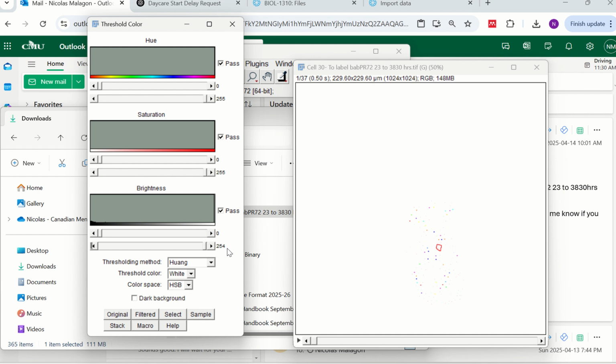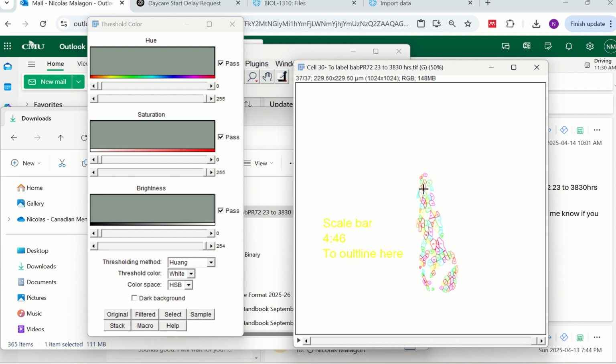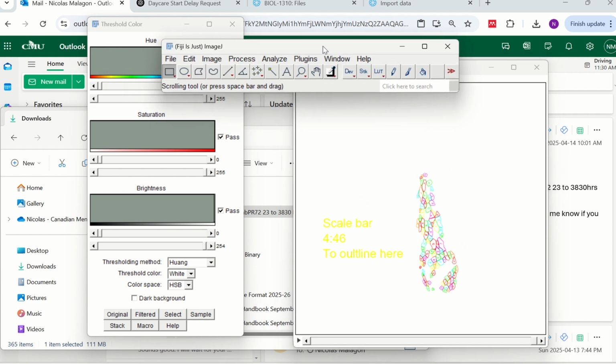Here, if you put it 254, you still keep the red thing. Now the next step is to not do it in one slide, but do it in all of them. So look, we press here, Stack, and look, it went and did the same thing in all of them. Okay, so perfect. Now we know that it's there, that it worked.